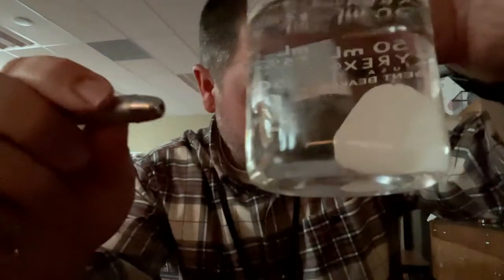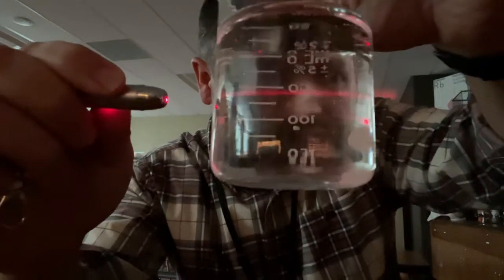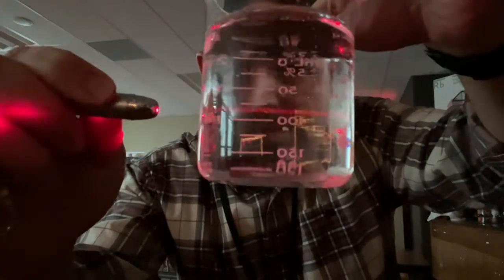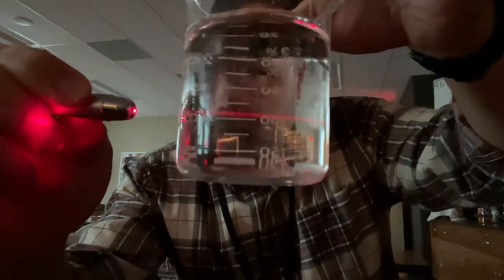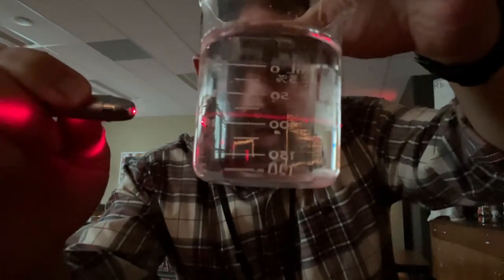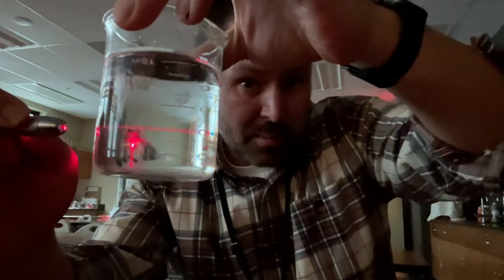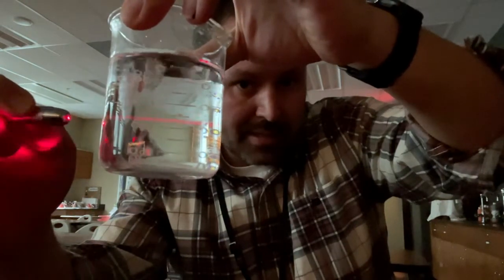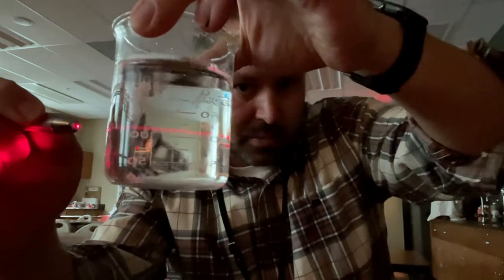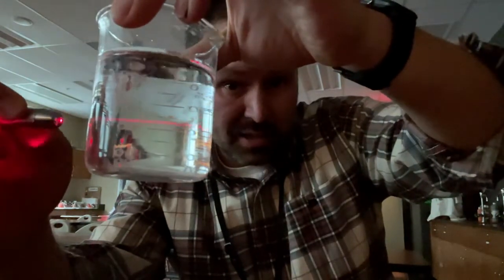This is the sugar water, and I'm going to go ahead and shine a laser through here. Can you see the laser beam through the water? I got to be honest, it looks like you can see the laser beam through the water, but sugar water should not have a laser beam through here. Do you know why it does? It's also the anti-caking mixture. For this one, I want you to go ahead and put solution.